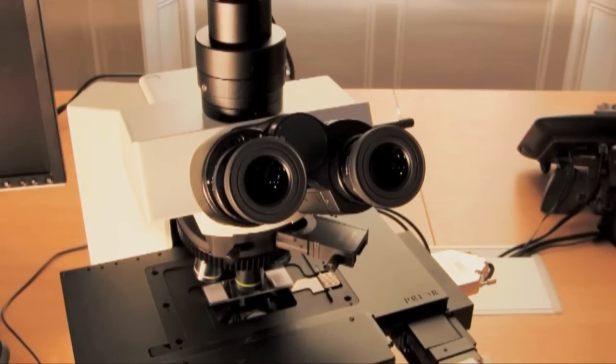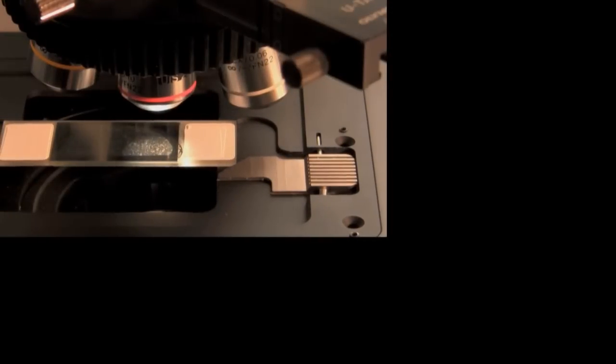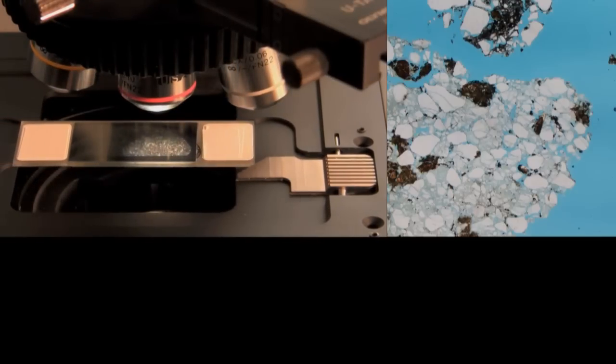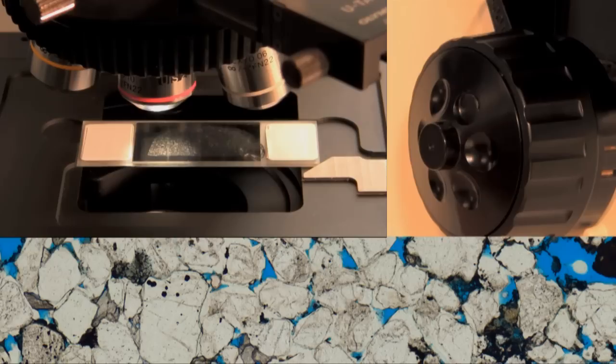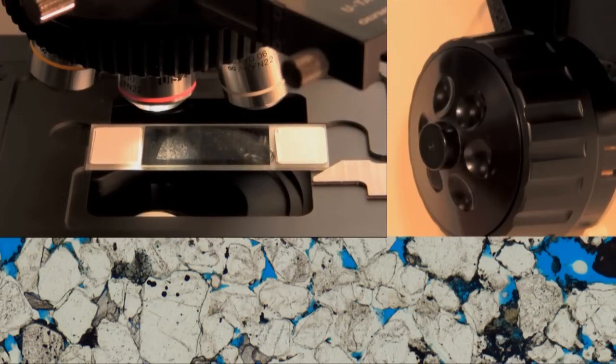So, how does it work? The automated microscope stage is programmed for the details of the individual thin section and begins the capture process. At each pause, a series of digital photomicrographs of the current field of view are recorded through a predetermined focal range. The program will then choose the most in-focus photomicrograph.